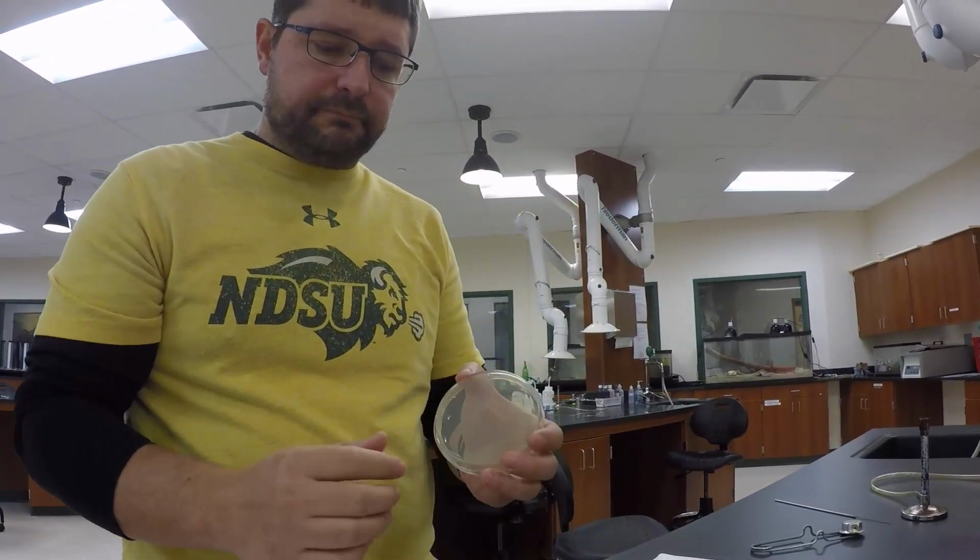Now, just because it has a more diverse bacteria doesn't necessarily mean that it's dirtier or worse for you. Okay? Now, the more bacteria you have in an environment, the greater the chance is that you'll have a bacteria there that could be harmful to an individual. Okay, so we're going to look at a few different environments, and I'm going to demo how this is done. Okay? So first, let's just talk about a Petri dish.